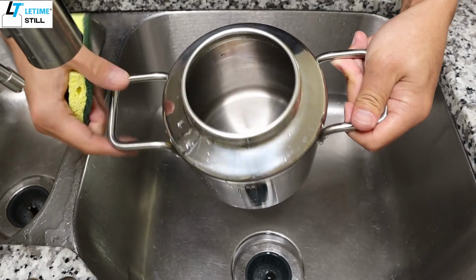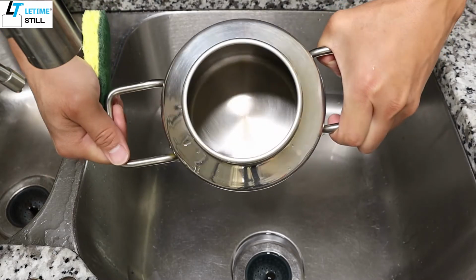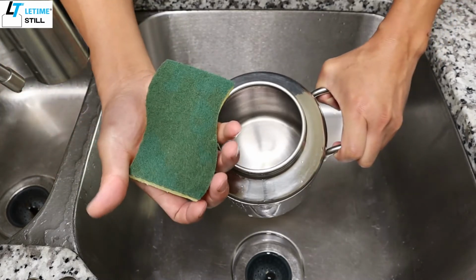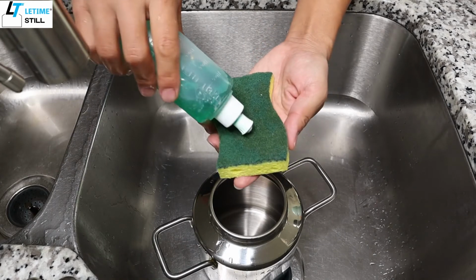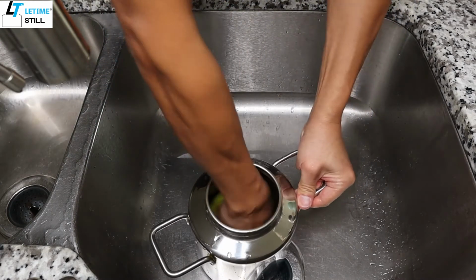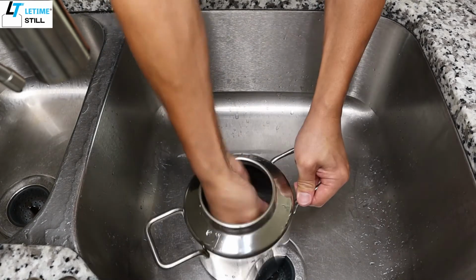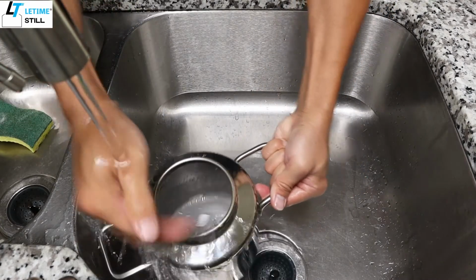After the vinegar wash, most of the scale has been dissolved, but there are still a few brown marks, so we can use this pad to scratch it with a bit of detergent. Do a circular scratching, also on the inner side wall, and rinse off.